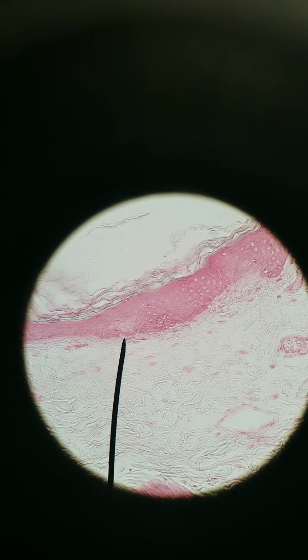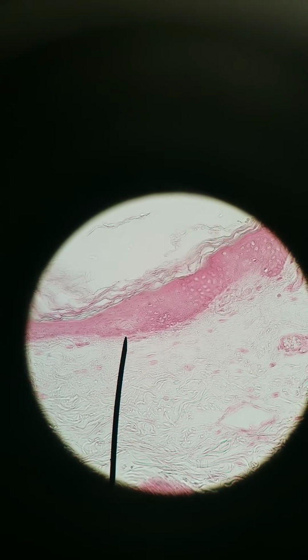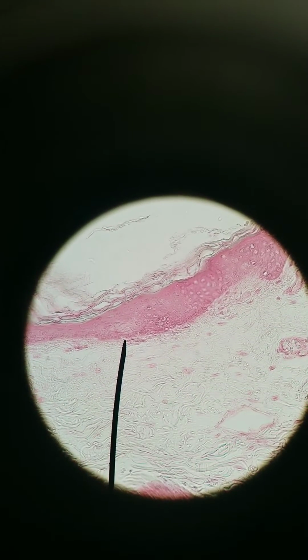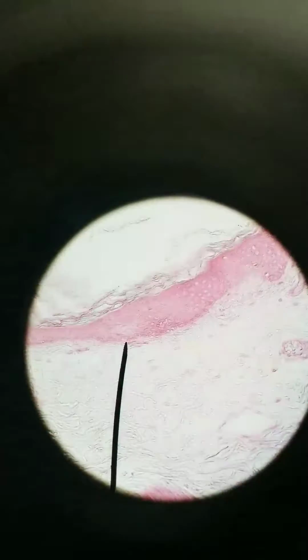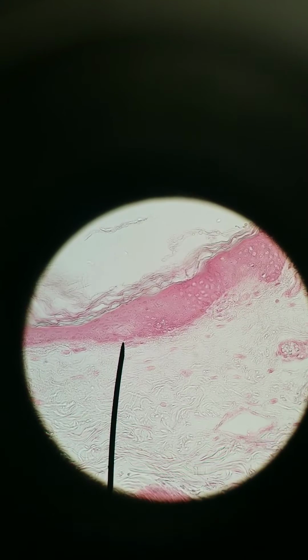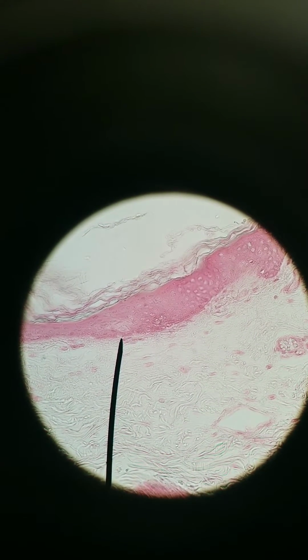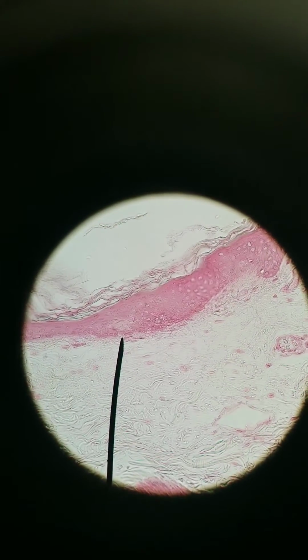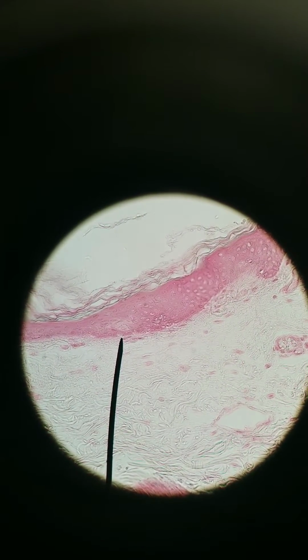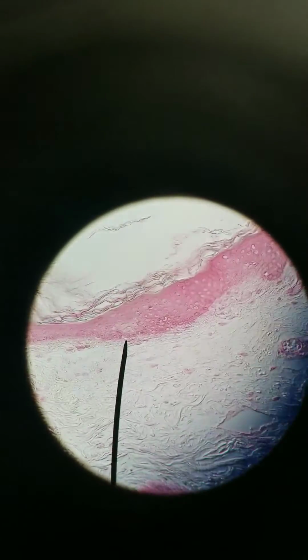If it is a Merkel cell, it helps detect very light touch, light flutter. And since it's a special receptor cell, this is actually neuroepithelium. This cell communicates with a nerve ending in the dermis, which you can't see, it's not stained for, and that nerve ending then goes to the spinal cord and communicates up to the brain. So what the pointer's pointing at, at 400x right now, is a Merkel cell.